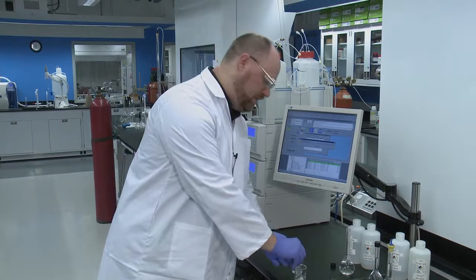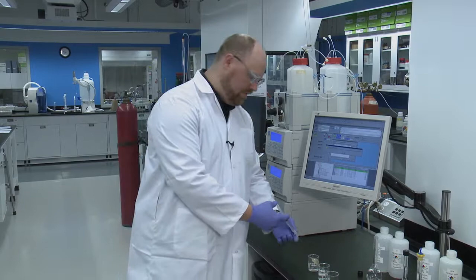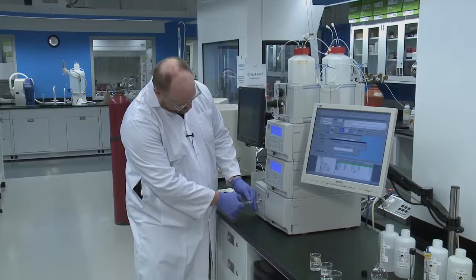Once that's done, we're going to load the syringe a second time. And this time we're going to do the injection. So we're going to put the syringe on. We'll just give it a little bit of a push to make sure that we're getting liquid out.